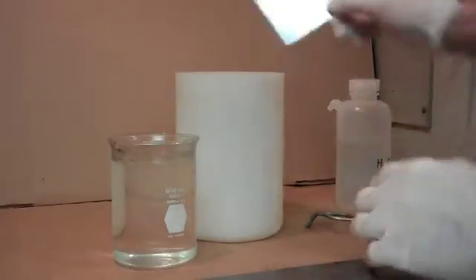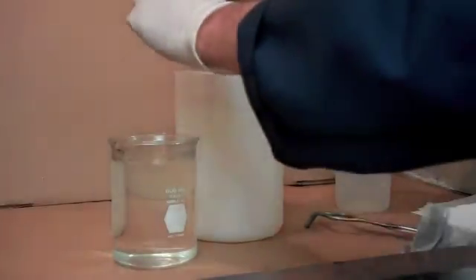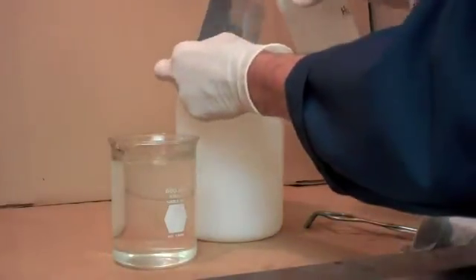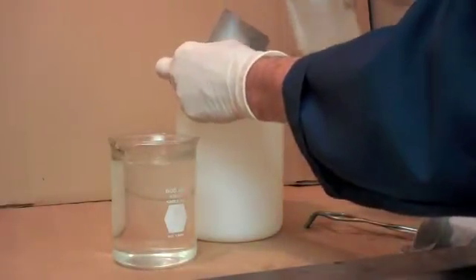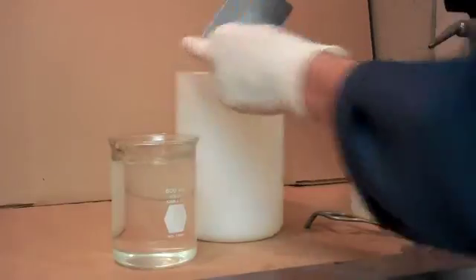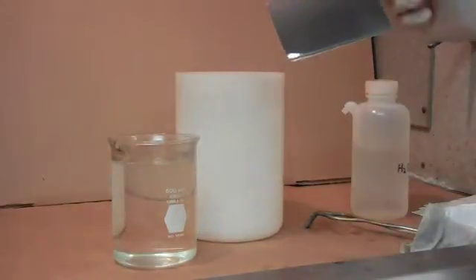Now we will take the panel and dip it in some fresh water and give it one last rinse of fresh water, and we are ready to begin our test.